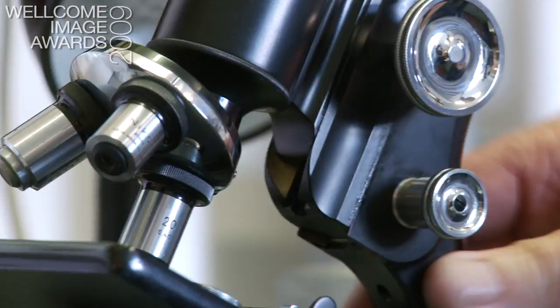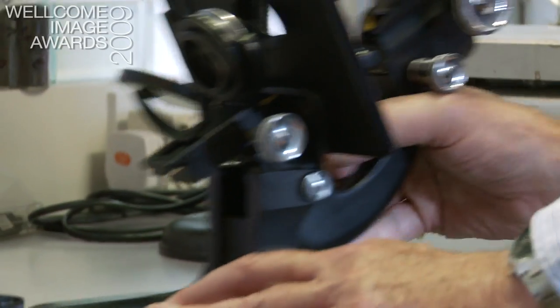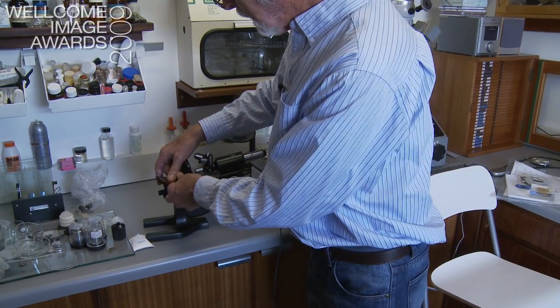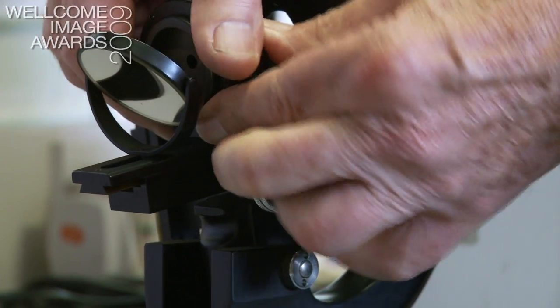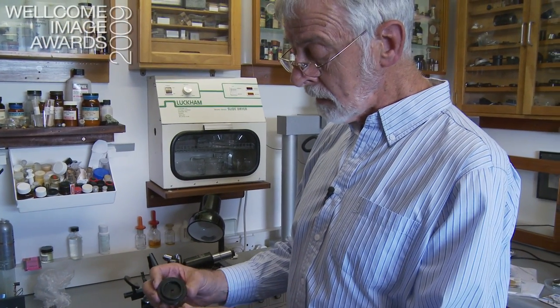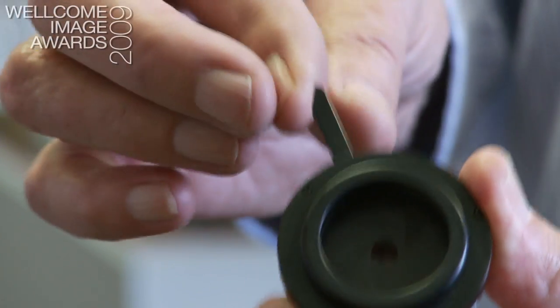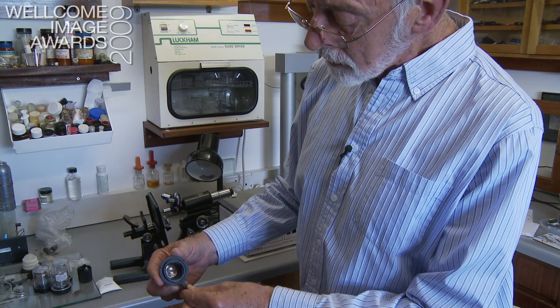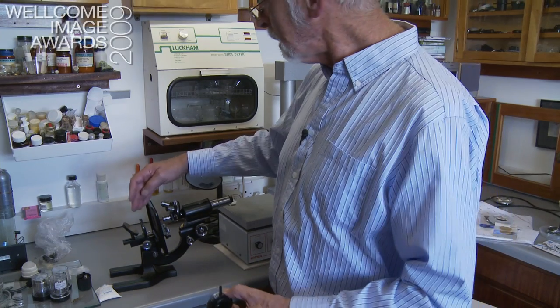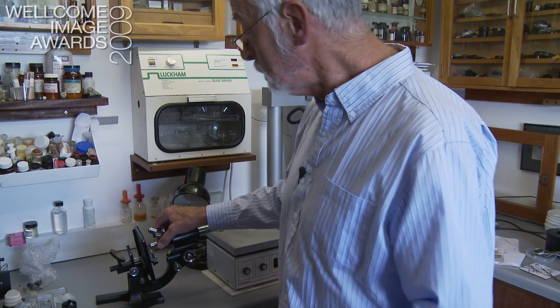Here we have the stage. Now underneath the stage, we've got the substage, and the substage has a condenser in it. That has the job of concentrating the light onto the specimen. Underneath, there is an iris diaphragm. People sometimes use that for making the image darker or lighter, but its real job is to control the behaviour of the light as it goes through the specimen and into the objective.